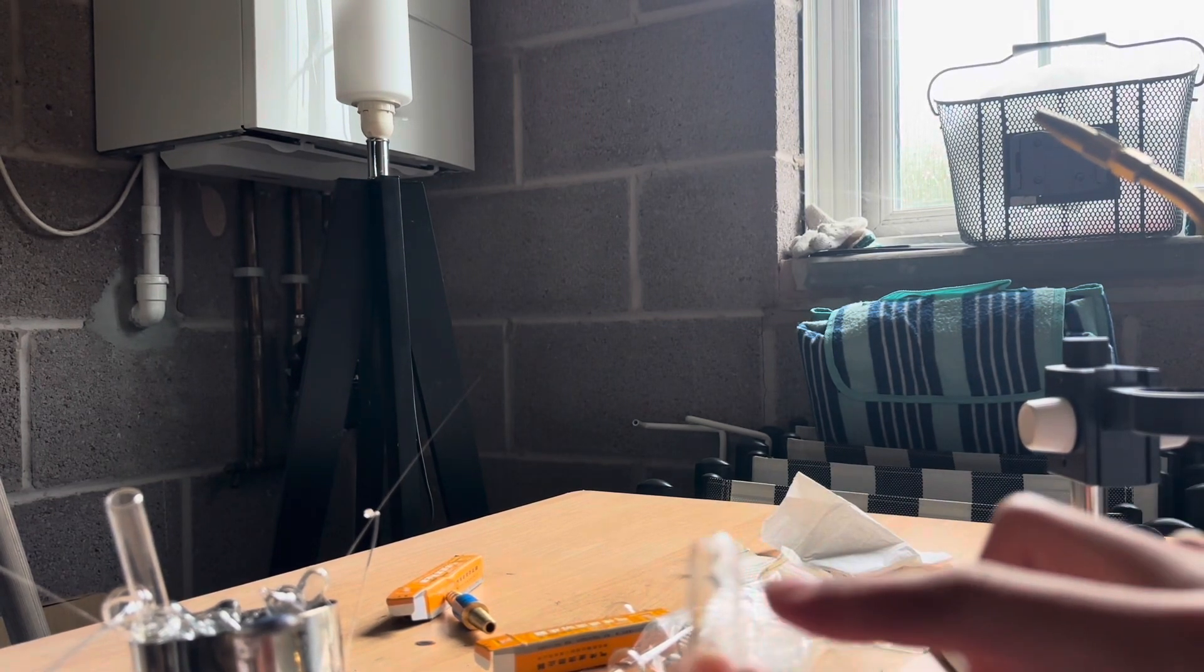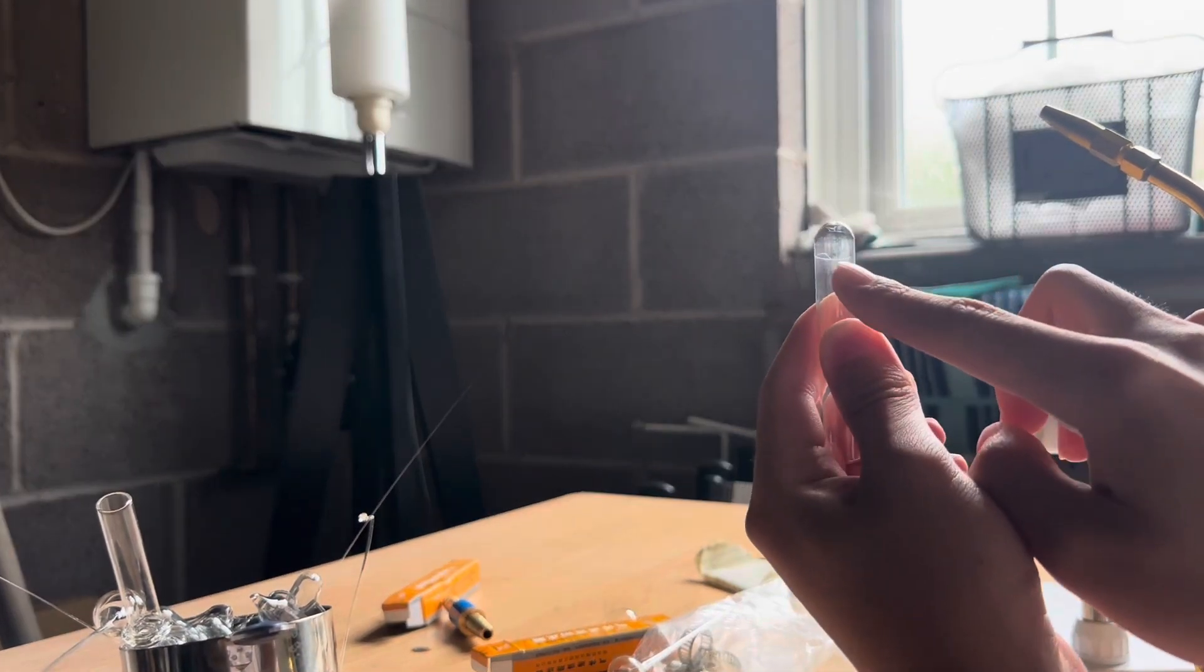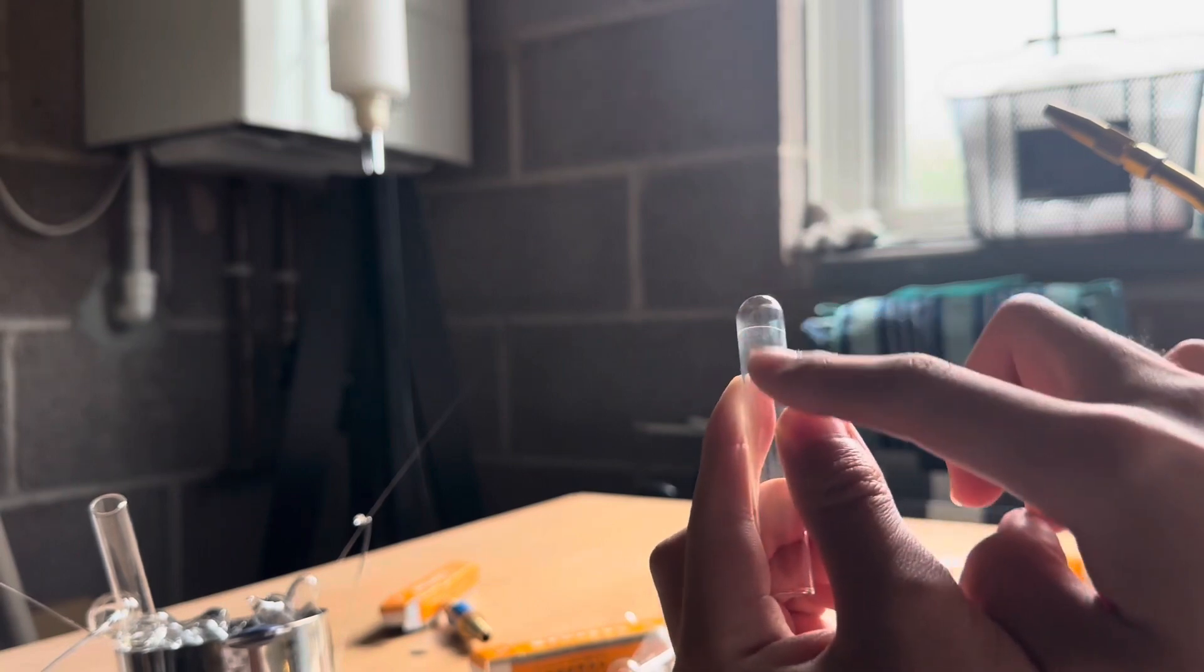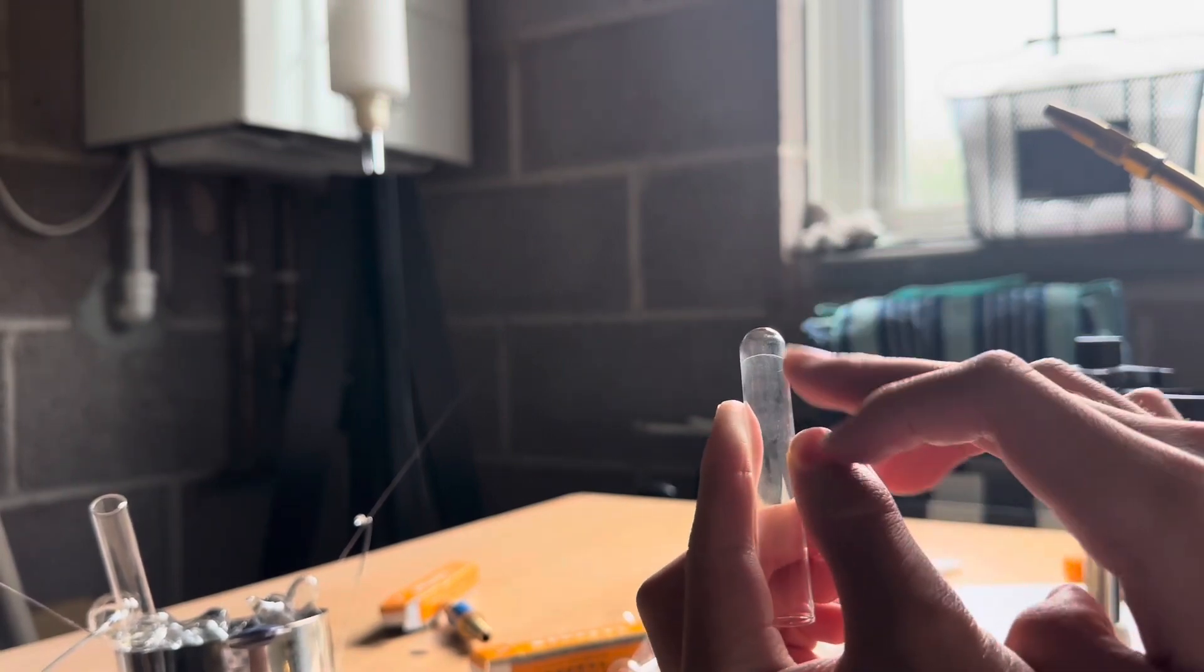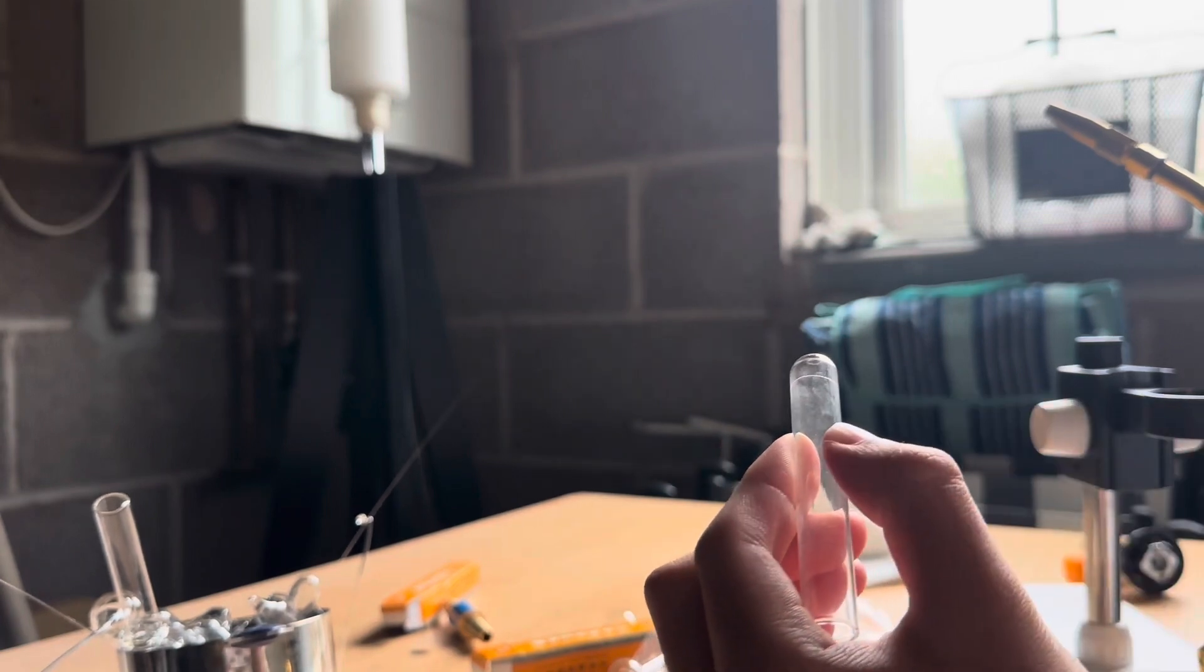This should be sufficient as the score line you can see here. The score isn't too big, but it just only have to be lightly. You can dab it with some water if you wish, or you can leave it dry, but make sure this piece of glass remains cool.